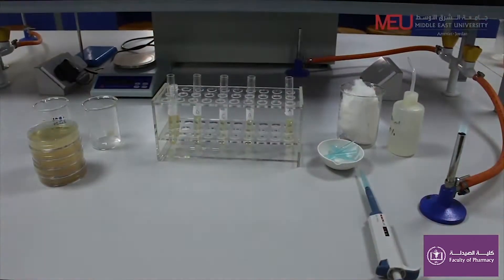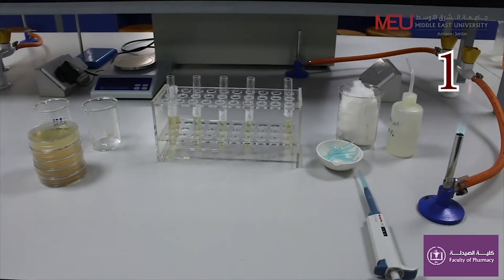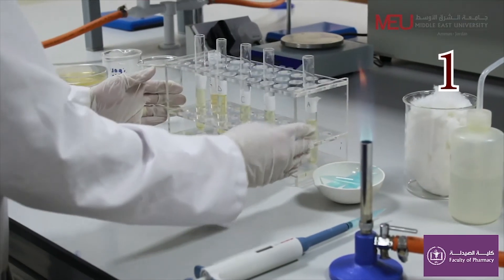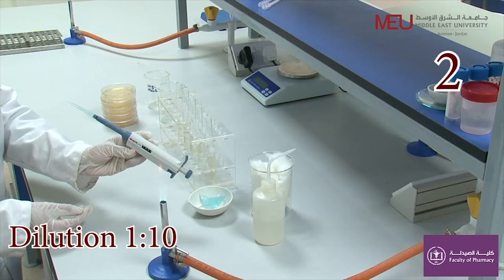Let's prepare a 1 in 10 serial dilution. First, prepare 5 test tubes containing 9 ml of saline solution.